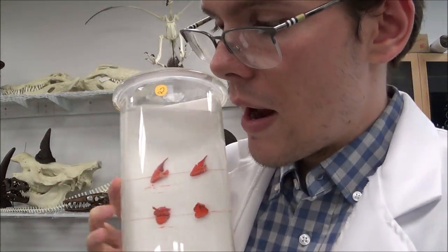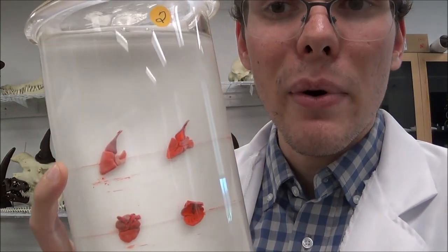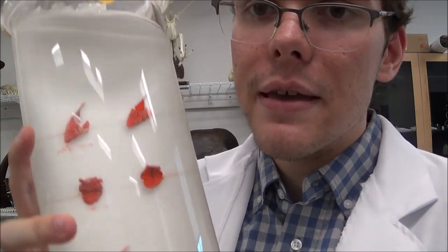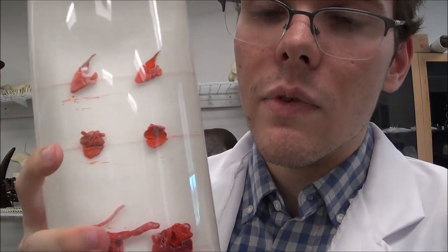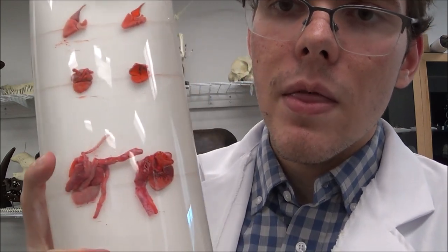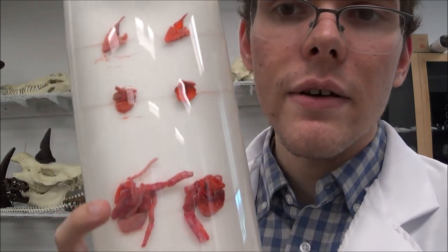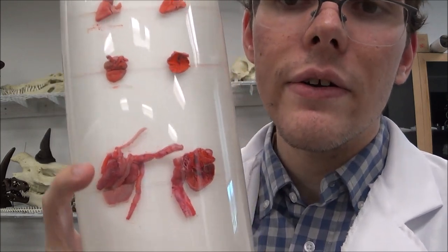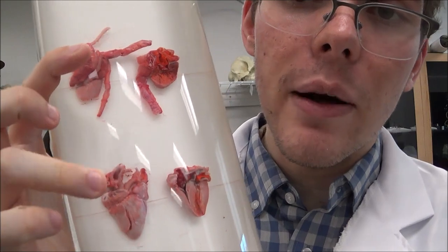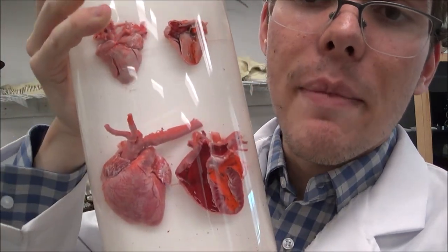Right here we have the hearts of a perch — a fish, just like the one we dissected last week — a frog, a snake heart, and that's a bird's heart. You're starting to get much more complex.